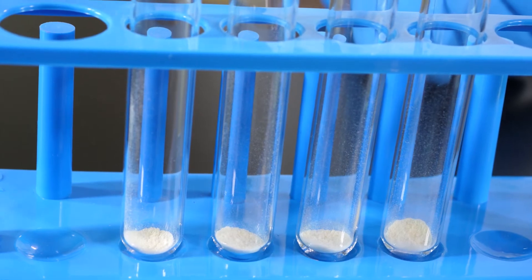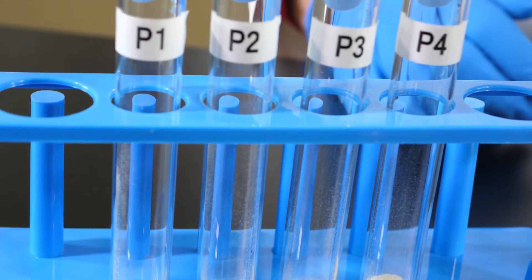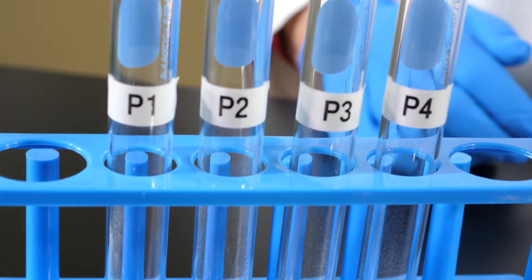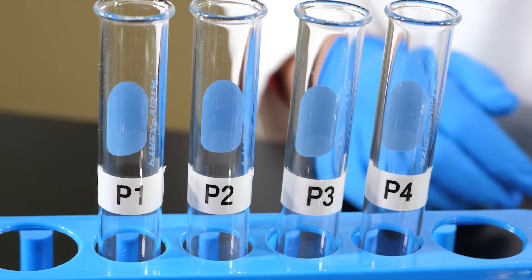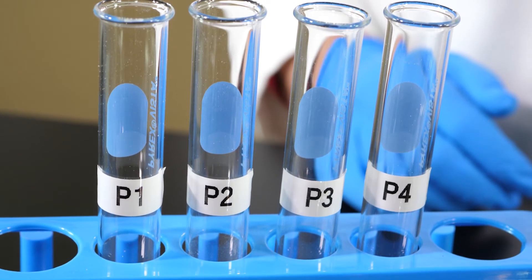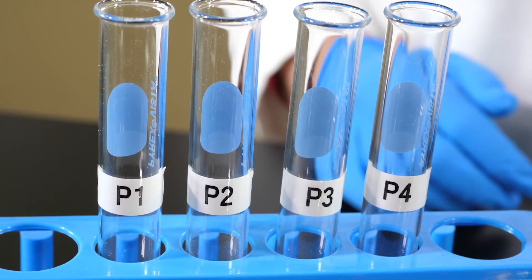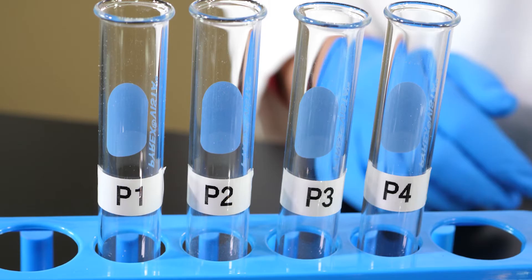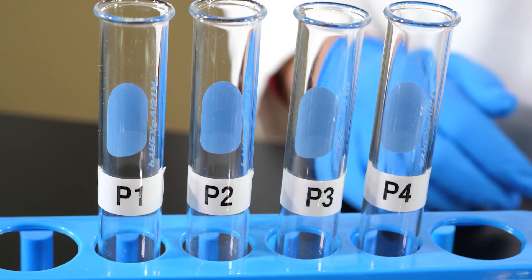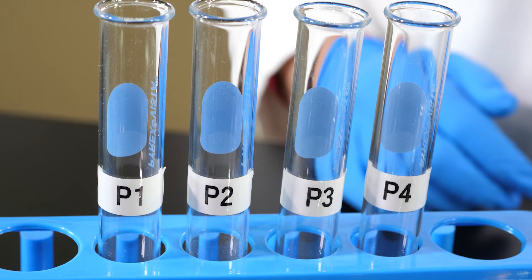A sample of powdered albumin has been placed in each of four test tubes. Each test tube has been marked with a P for protein digestion and labeled P1, P2, P3, and P4.